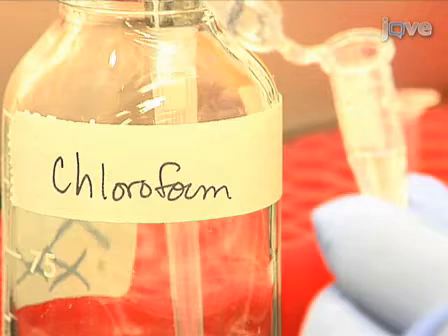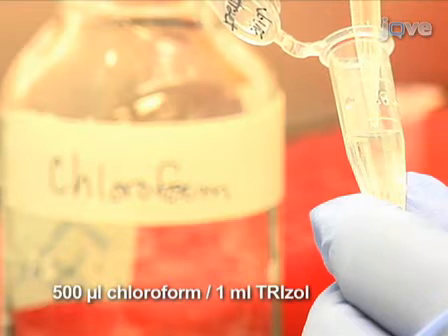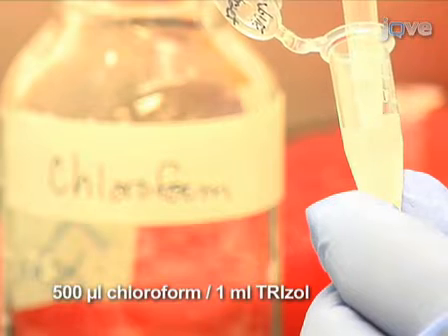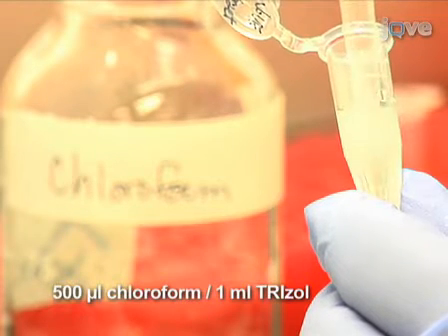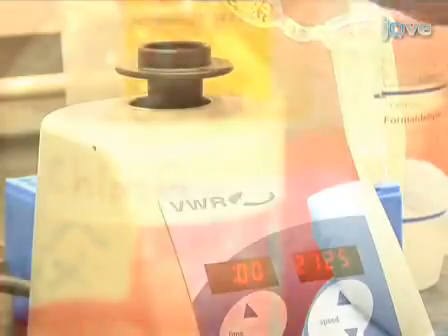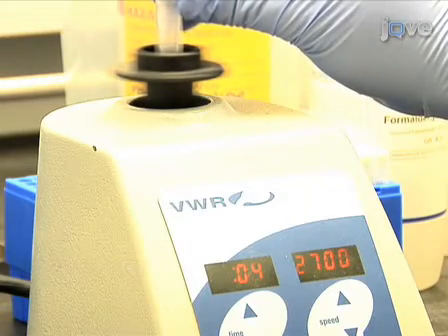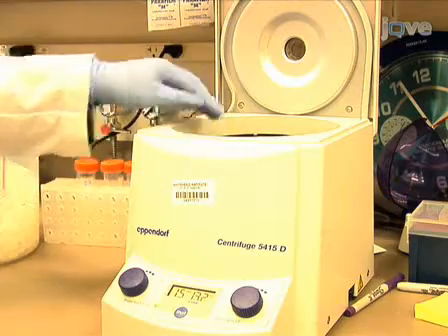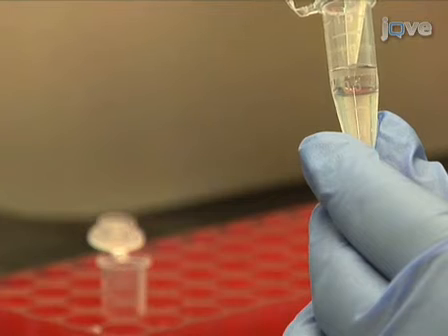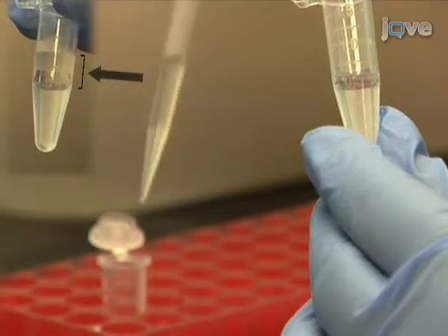Do a second phenol chloroform extraction, this time using 500 microliters of chloroform per 1 milliliter trizol instead of BCP. The second chloroform extraction is used to remove any traces of organic solvent from the extraction, as even trace amounts can inhibit subsequent amplification steps. Vortex or shake vigorously, then incubate at room temperature for 2 to 3 minutes. Centrifuge the sample at 12,000 Gs for 15 minutes. After centrifugation, transfer the aqueous phase to a fresh tube. Remember, the aqueous phase is the clear layer on top.